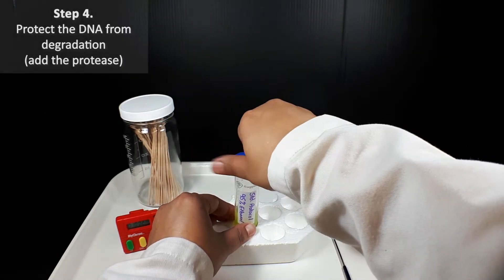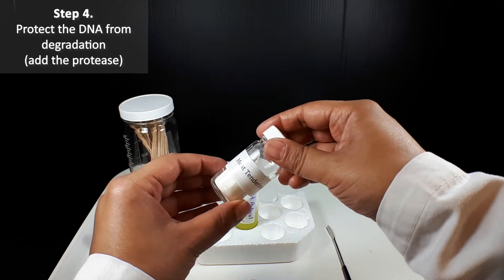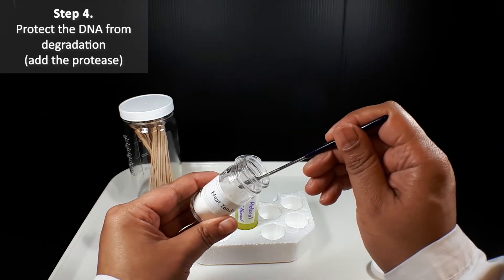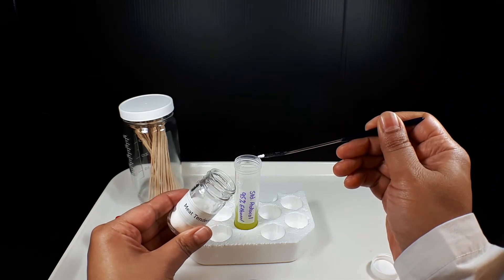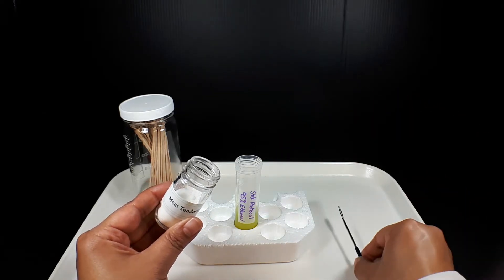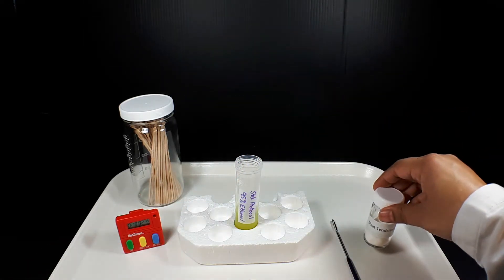When the 10 minute waiting period is over and the DNA is fully exposed, it is now at risk of degradation by cellular nucleases. To help prevent this, we add a small amount of protease. In this experiment, our source of protease is a powdered meat tenderizer.